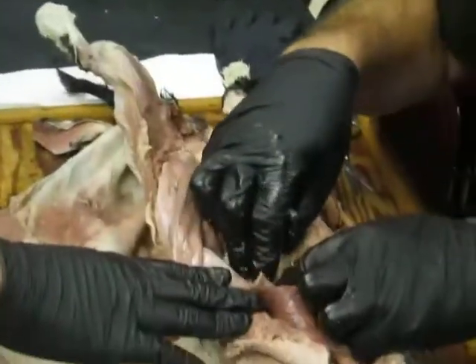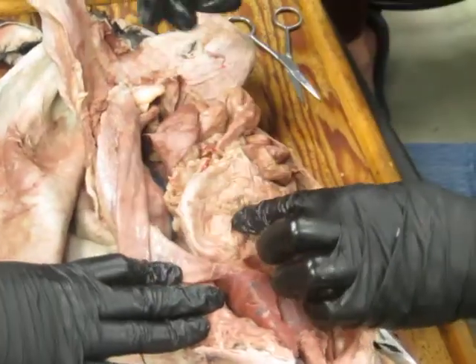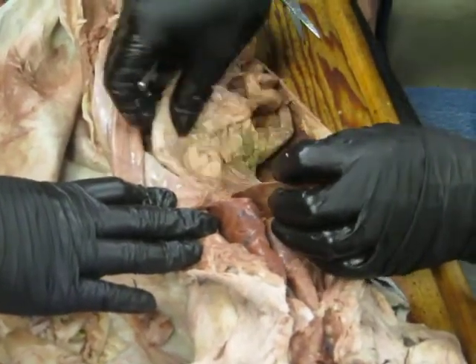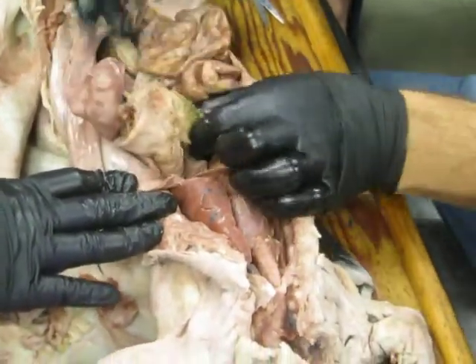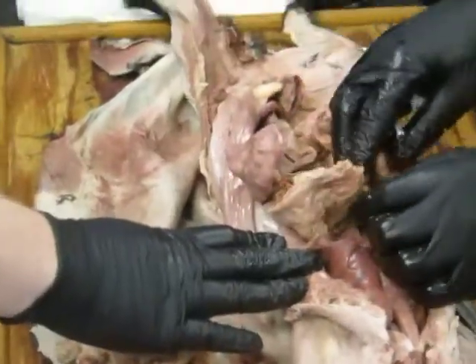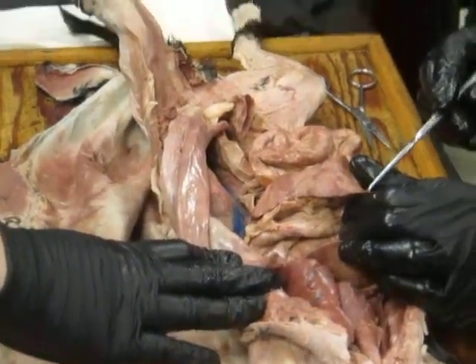It's a little hard to see the connection there, but right here is the esophagus coming down into the stomach. That's the cardiac region of the stomach. The place where it kind of bulges up above the cardiac region is called the fundus, and then it wraps down into the body and eventually comes down here to the pylorus, the pyloric region of the stomach. And that ends right there, and we get to the duodenum. Dangling off of the stomach, though, is a big organ, this here, and that's the spleen.